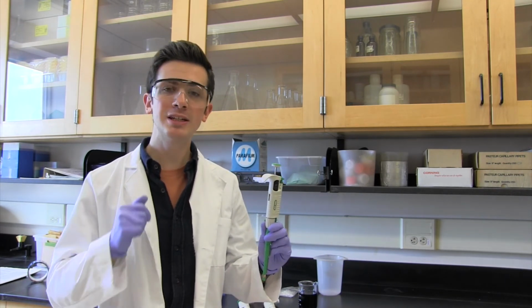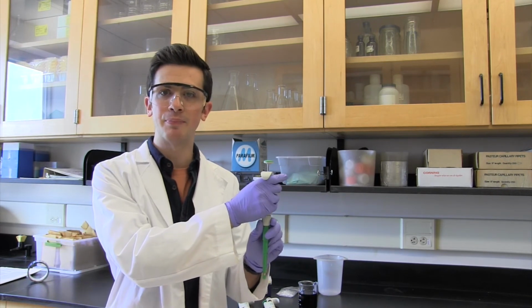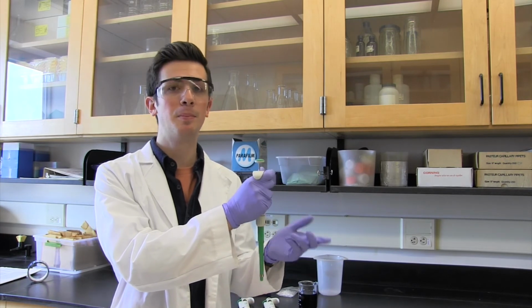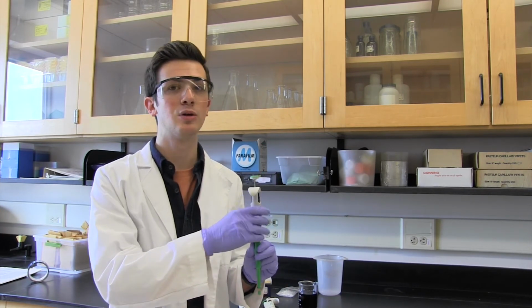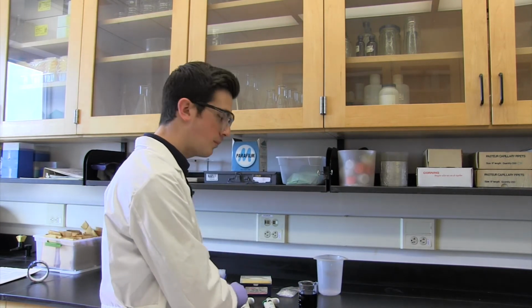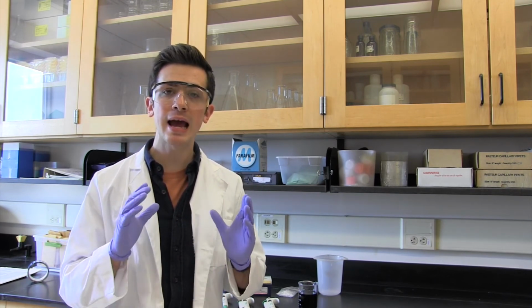On that note, make sure you have a secure grip when using the pipette. Dropping one of these can not only damage your experimental success, but damage the pipette. And one of those costs money. Always make sure that your lab bench is clean and you use proper safety equipment. While pipettes are very accurate mechanisms and can always be used safely, there's always some risk of experimental failure. Because you're working with liquids, you could splash. So, make sure to be prepared.